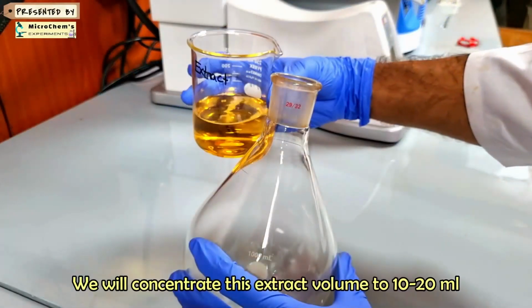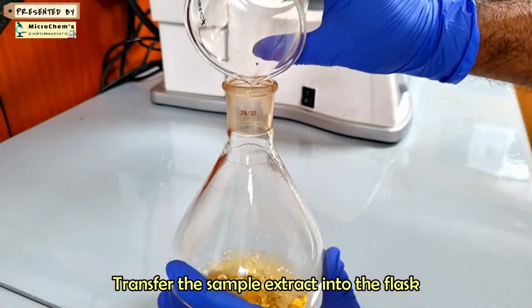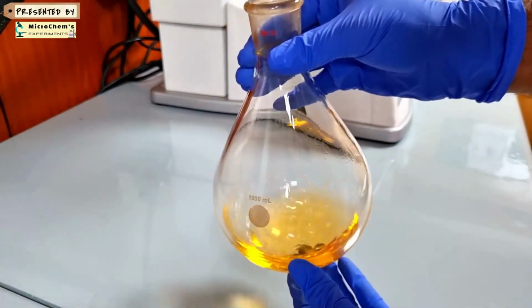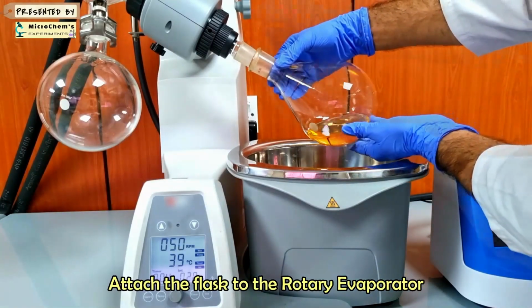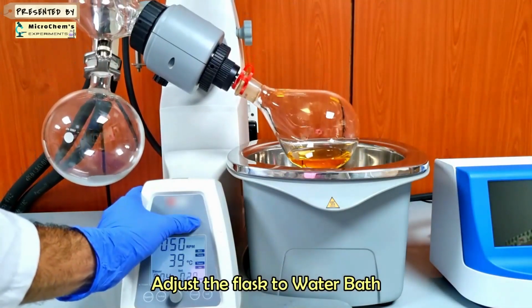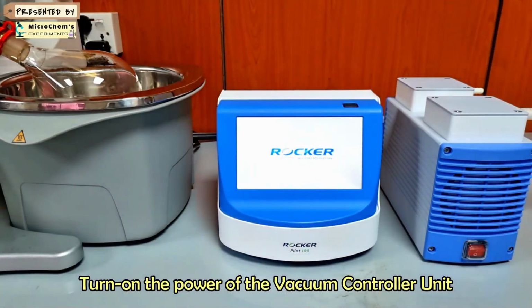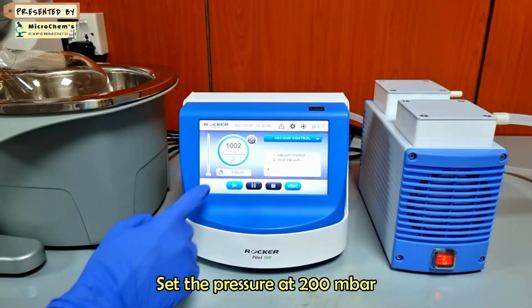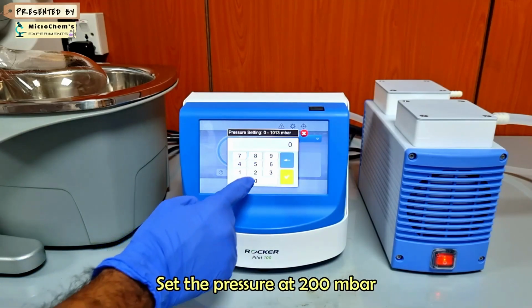Let's concentrate the extract volume to 10 to 20 ml. Transfer the sample extract into the round bottom flask. Attach the flask to the rotary evaporator. Turn the power on of the vacuum controller unit. Turn on the pump. Set the pressure at the proper point. In this case, 200 is enough.